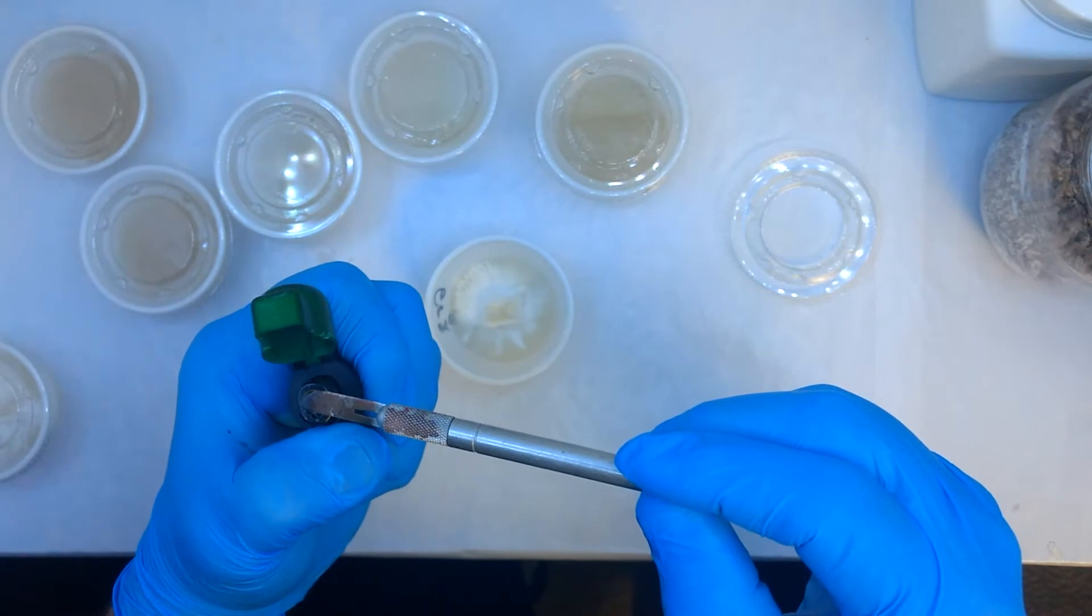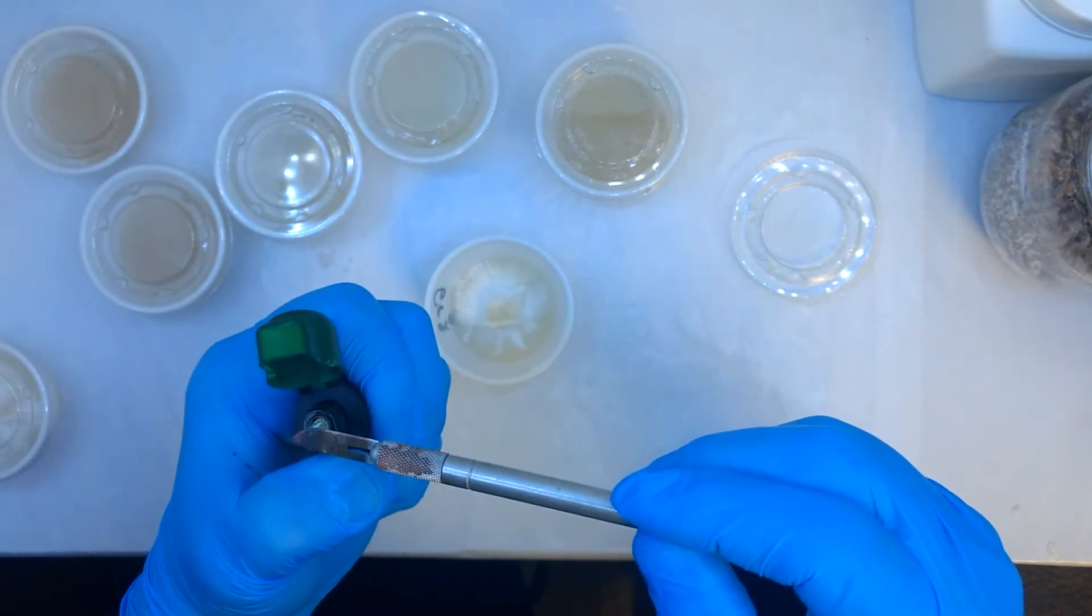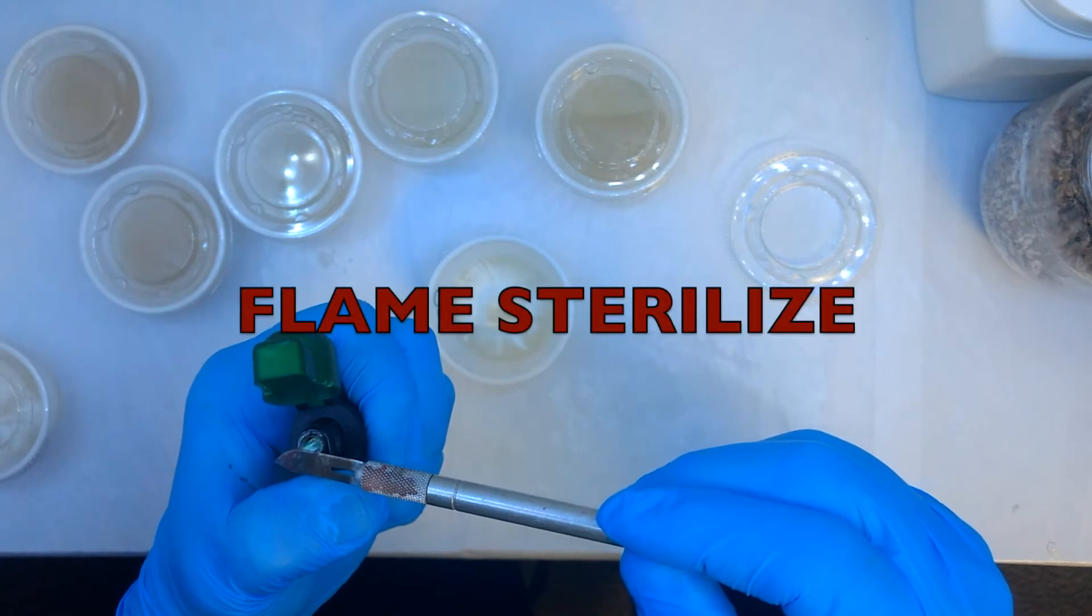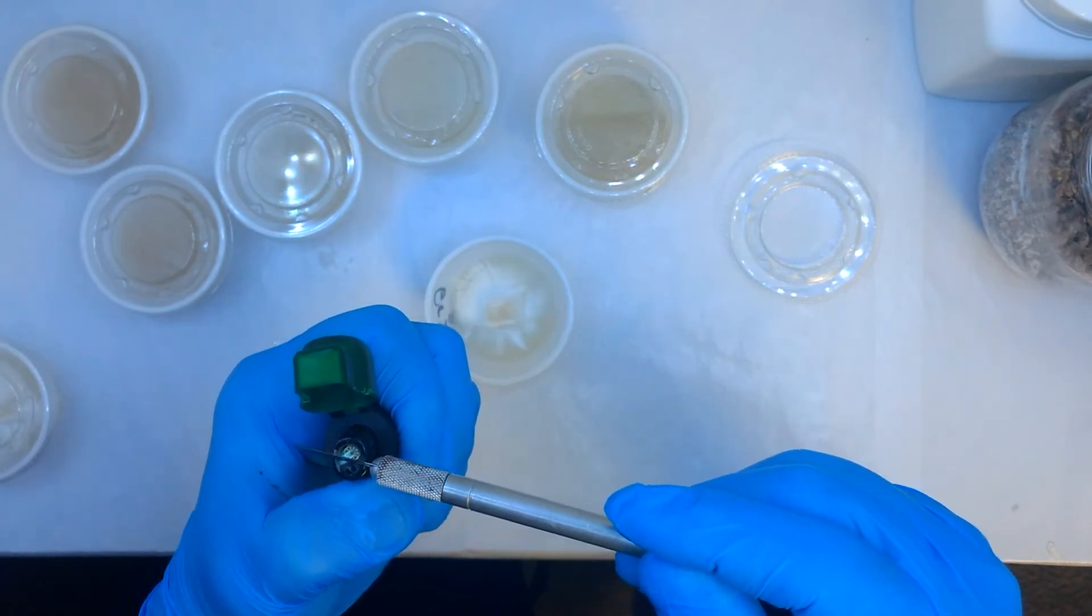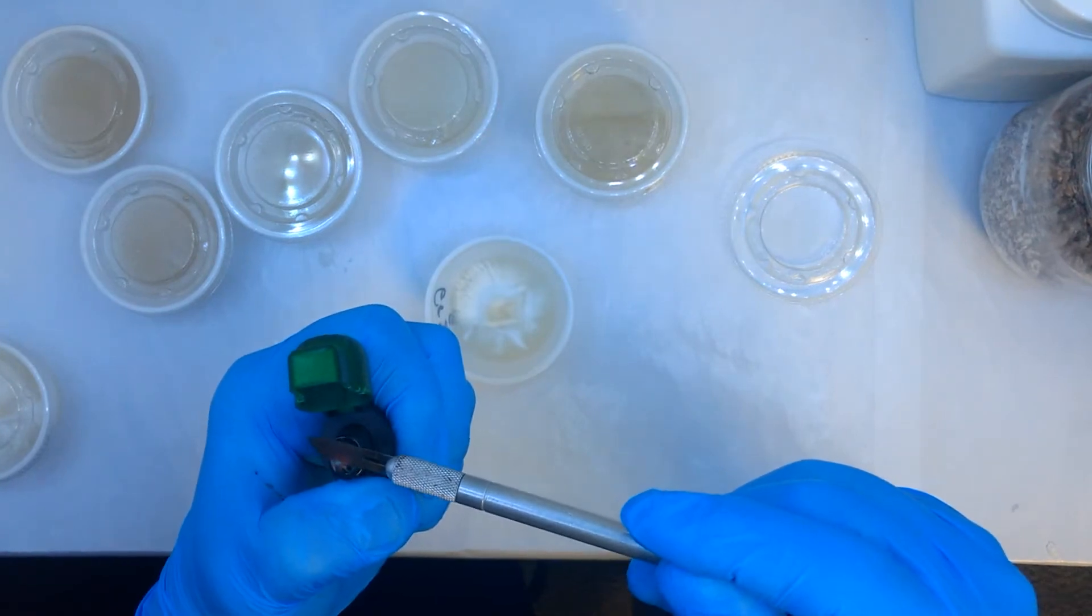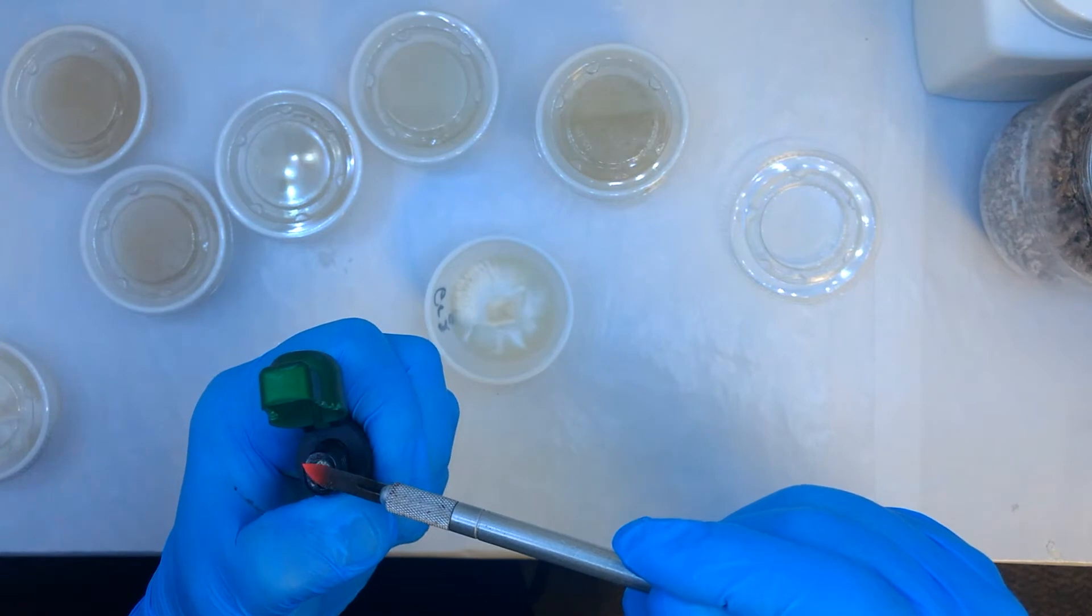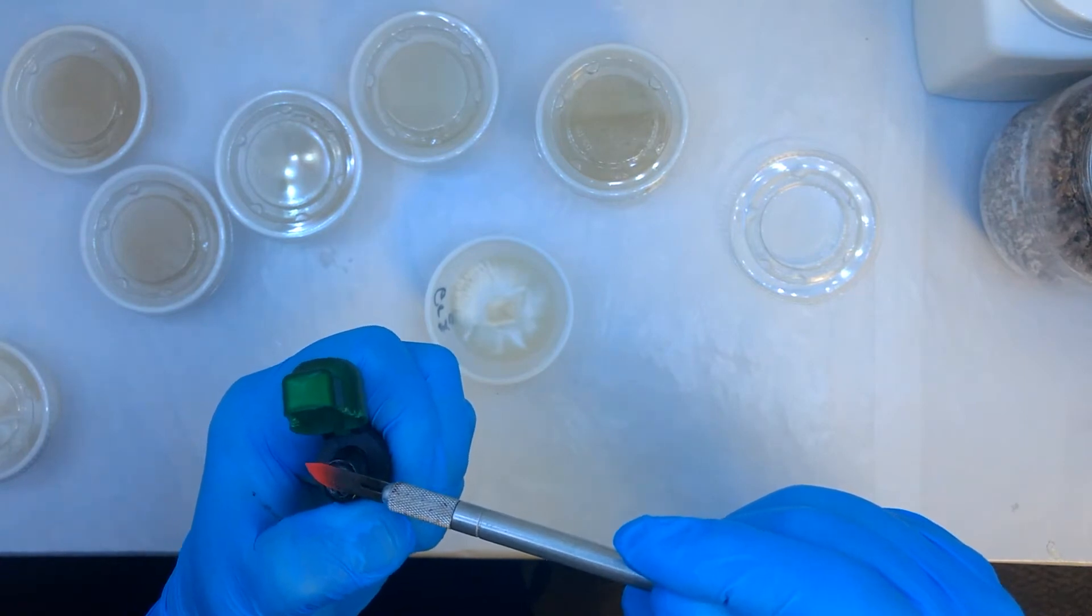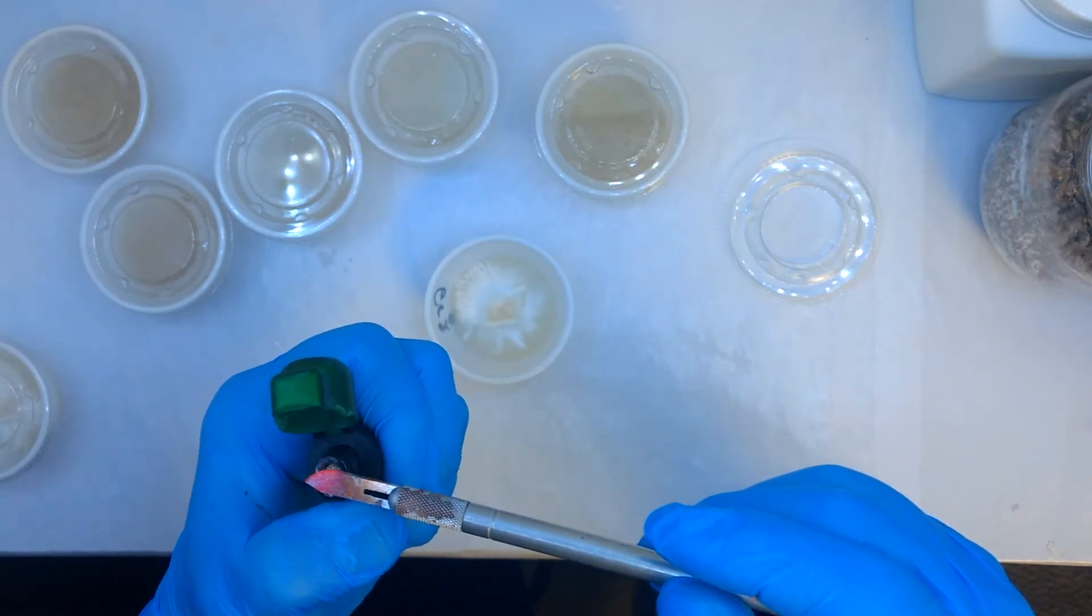Here we're flame sterilizing the scalpel. You have to flame sterilize and alcohol your work area just to make sure that there is no contamination. Get this red hot. I find using these lighters from the dollar store quite amazing, they work very good and they last quite a while.